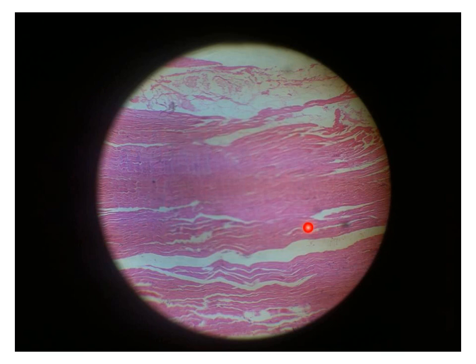longitudinally sectioned skeletal muscle fibers, and in between we have this white area. They represent the place where the connective tissue was present, but it was cut during preparation of the section. So we don't have any slide formed of parallel red ribbons with white separations like this in your sections.